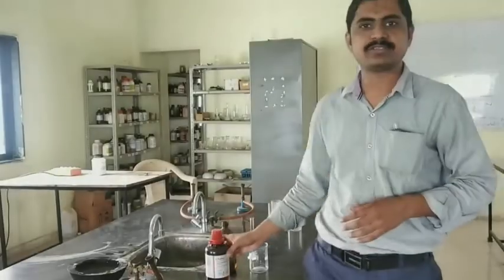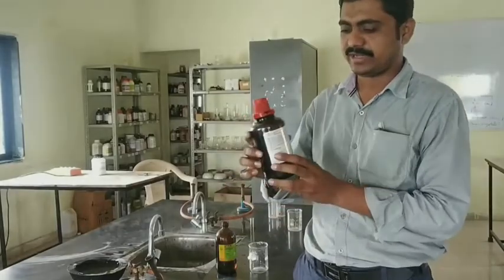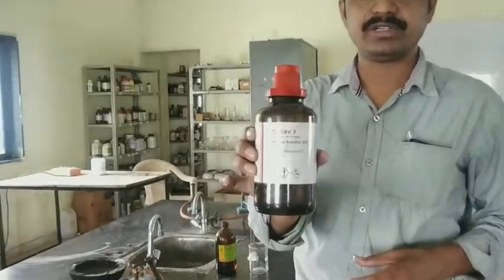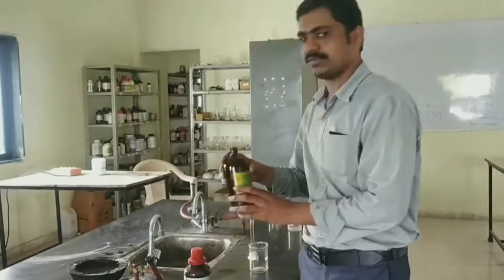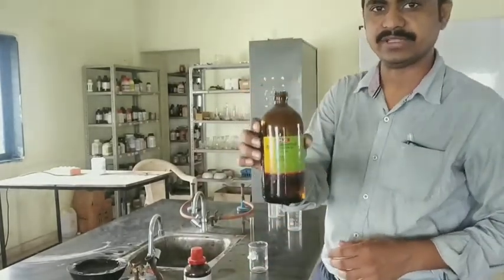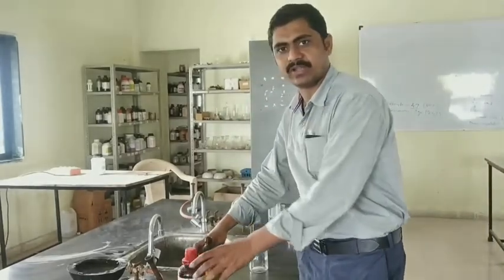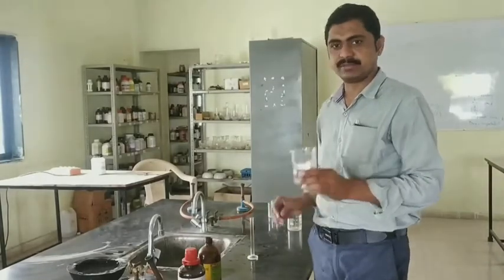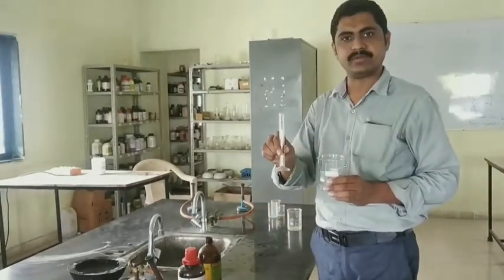For the synthesis of hexamine, the chemicals required are ammonia solution and formaldehyde solution. Only these two chemicals are required. For apparatus, a glass beaker and measuring cylinder are required.